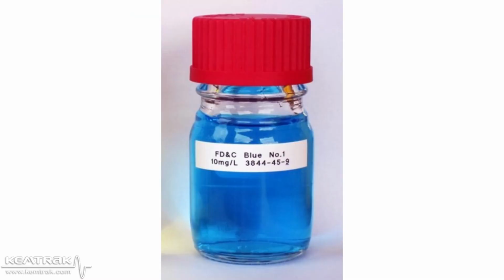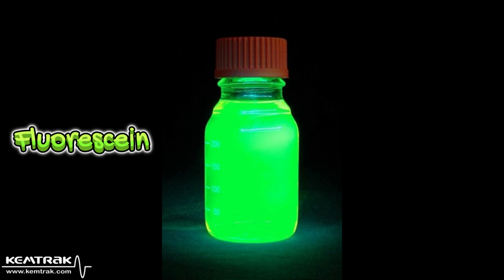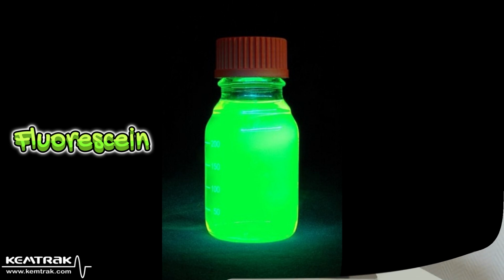Monitoring ethylene glycol is challenging because it is a colorless liquid that cannot be measured directly. A commonly used technique is to mark the coolant with a dye and monitor traces of this marker in the steam condensate or product in real time. Suitable FDA-approved dyes for the coloring of food and drugs include brilliant blue and fluorescein.